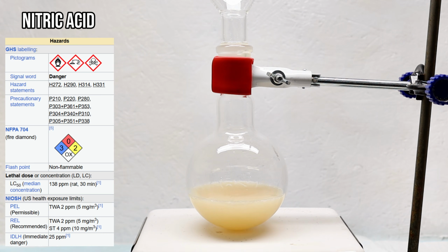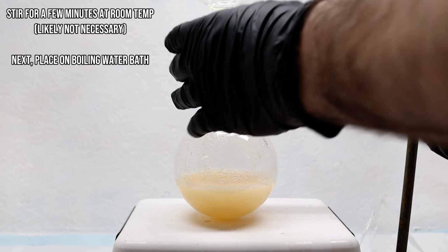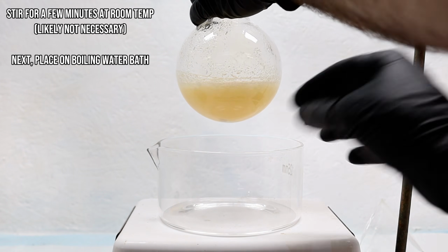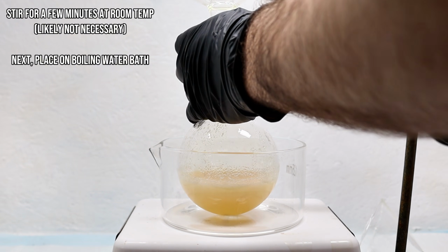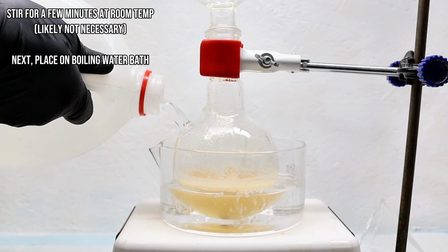However, nitric acid is also volatile, corrosive, and releases toxic nitrogen oxides as byproducts, so I'll be doing this step in the fume hood. To get started, I began by adding 21 grams of the benzoin to a flask, followed by 100 milliliters of 60% nitric acid. I stirred the mixture thoroughly for about 5 minutes at room temperature to allow the two chemicals to mix, and then transferred it to a boiling water bath in order to drive the reaction forward.